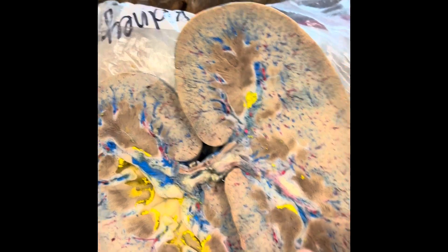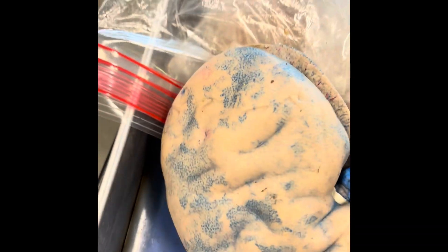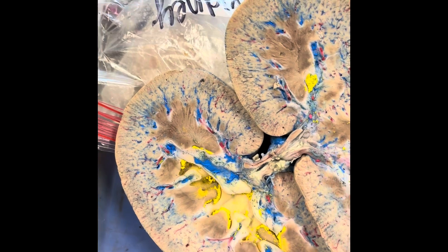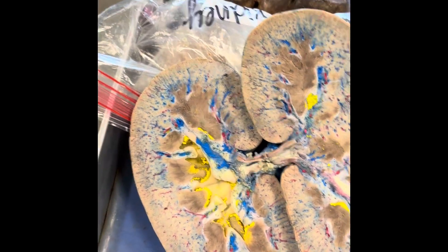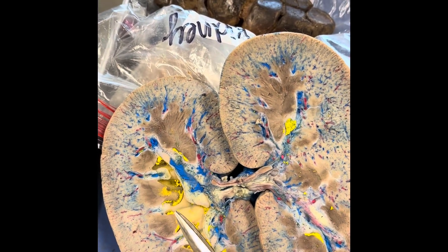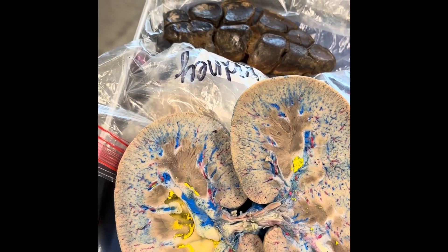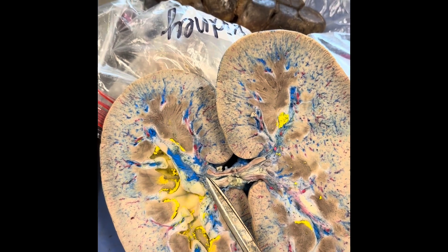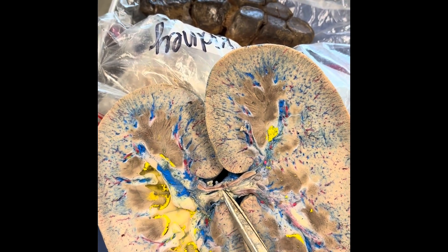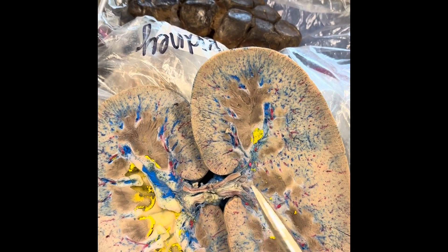Here is a pig kidney and this happens to be opened up. This is the outside of the pig kidney — the bean-shaped kidney. There's the ureter there, and then we did open it up so that you could see the cortex around the outer edge, the medulla in the middle. The cortex and the medulla is where the nephrons are found, the functioning unit of the kidney. That waste drains into the renal pelvis, and then the renal pelvis drains out the ureter.